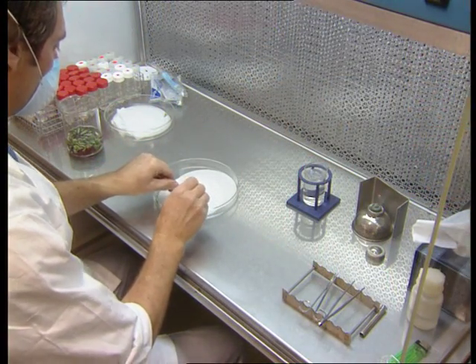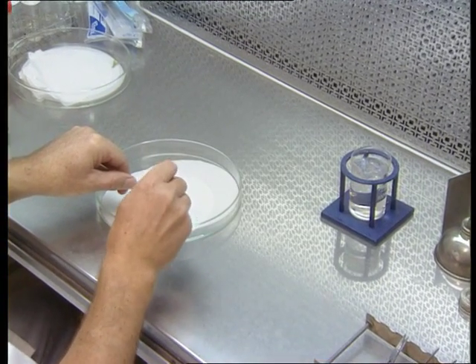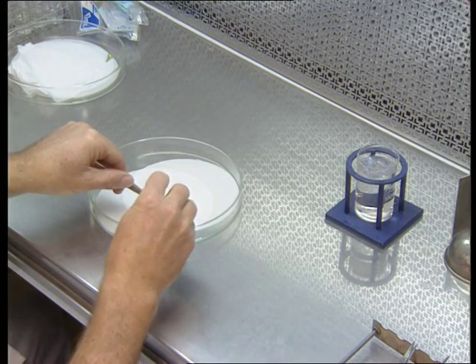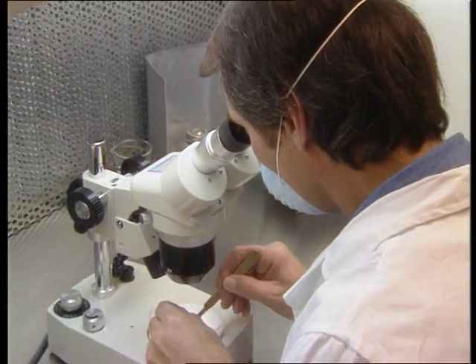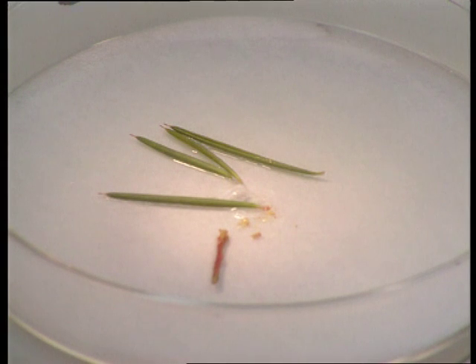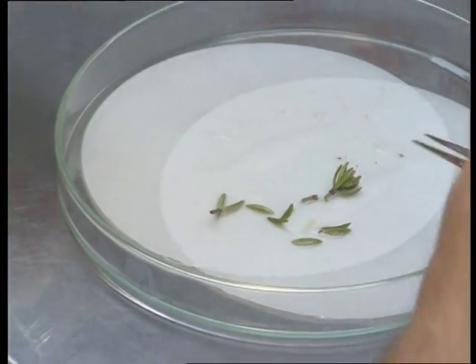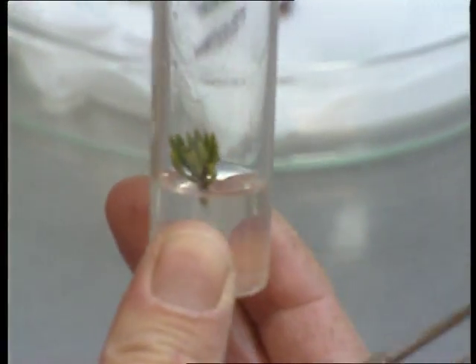Let us look at the preparation of the explant. The exact method for preparing the explant varies with the kind of explant. In general, all procedures described up to here should be followed. If shoot tips are used, remove the disinfested shoot pieces from the rinsing solution and cut away the enclosing leaves with sharp scalpels or needles to expose the immature shoot tip. Removal of only the meristem dome and a few leaf primordia requires very fine microtools and use of a dissecting microscope. The work must be done quickly and the pieces inserted onto the gelled medium quickly to minimize desiccation.